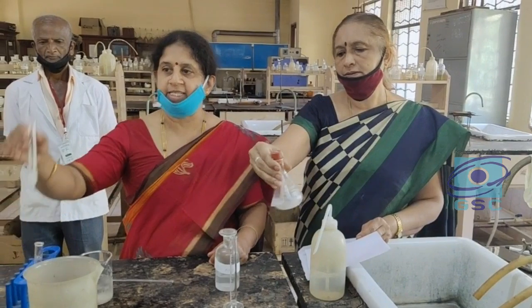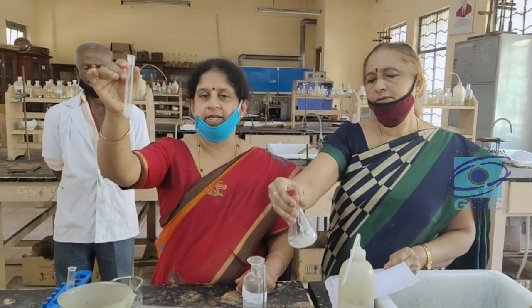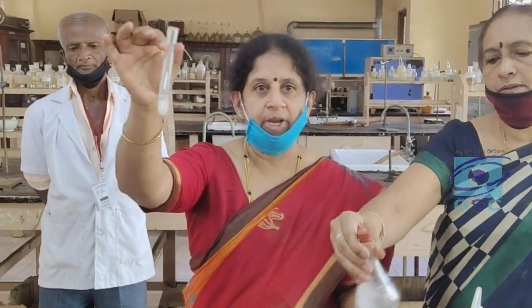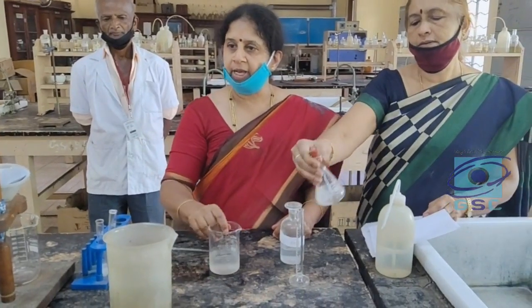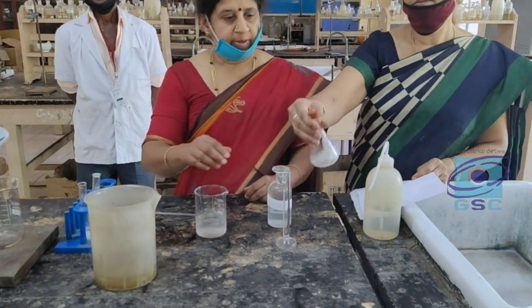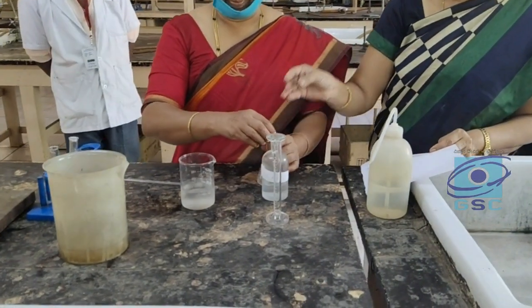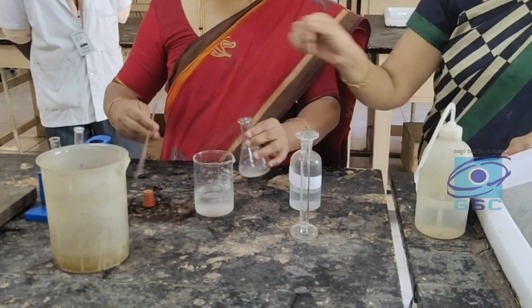So just to test on a small scale in a test tube, we can make out whether the compound has been prepared or not. Now we can pour the contents into the beaker containing ice cold water.